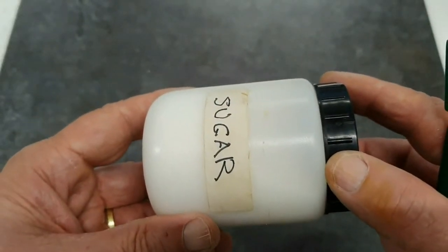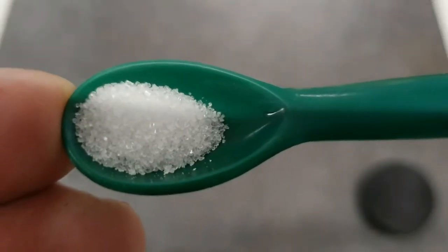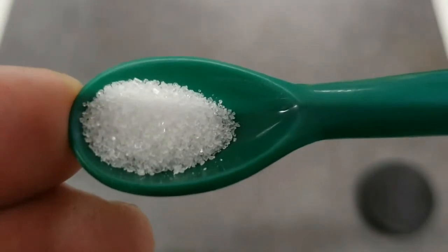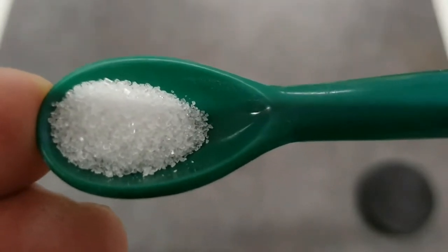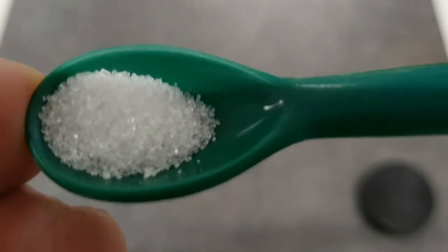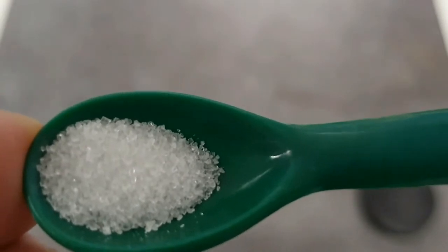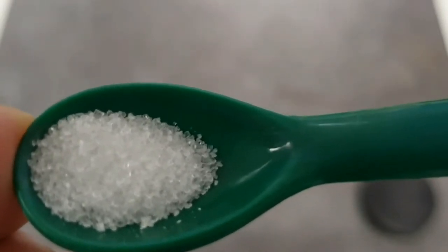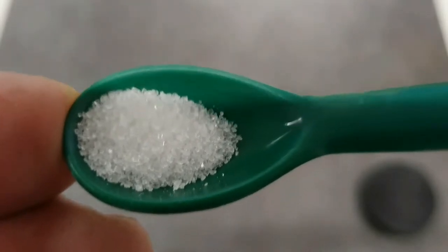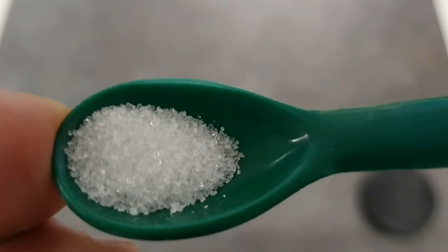Our next one now, as you can see, is sugar. Colour, again, might I suggest white? Does it have a lustre? Well, no, it doesn't, even though you can see that it is made of crystals, and those crystals are reflecting light, indicating a shiny surface. But not really, we don't describe crystals as having a lustre.